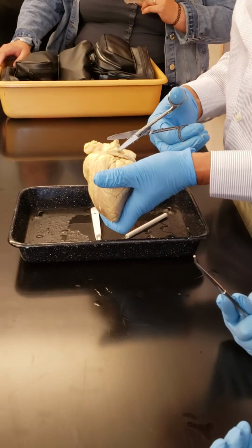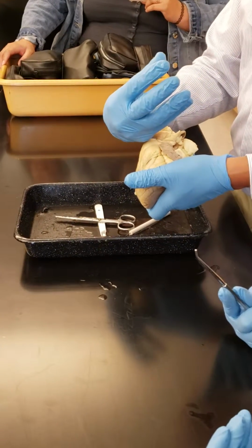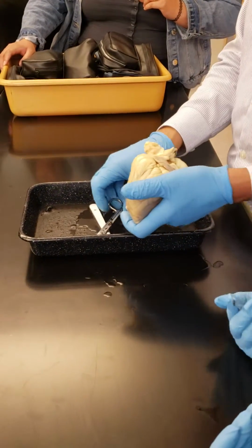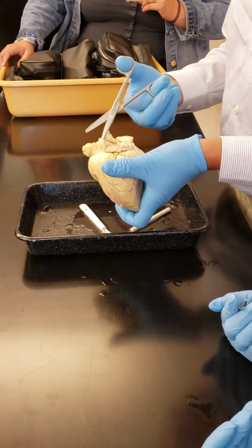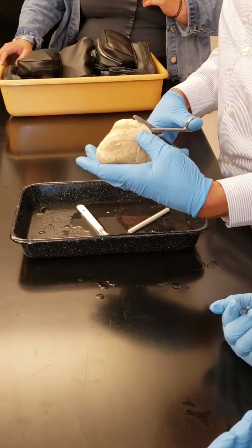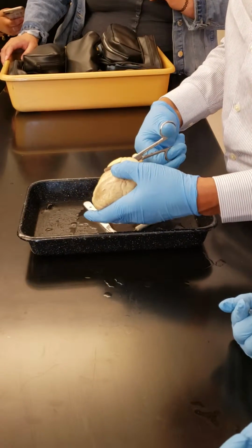Okay. And these are like pockets. These pockets go like this, facing up, so that when the blood goes back, the pocket becomes full. It is a very thin membrane, just like my pocket today. Okay, I'm giving it a cut. I keep giving a cut. And just to show you, I don't need to go that far, but just to show you.